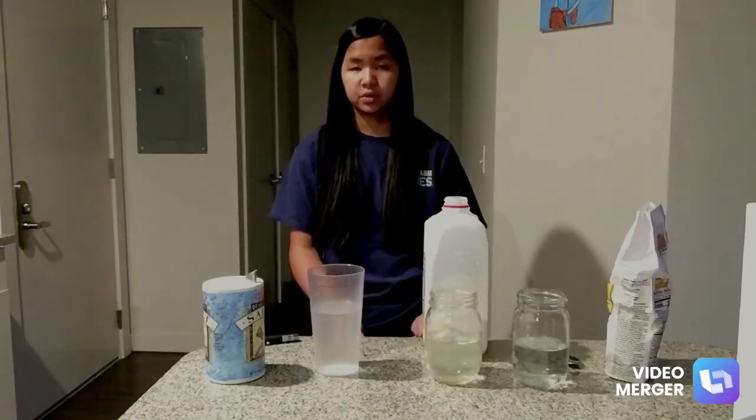My name is Bailey Glaze, and this is my Chem lab video for Chem 120, where I will be explaining the Tyndall effect. The Tyndall effect is the scattering of light by particles in a colloid or suspension.